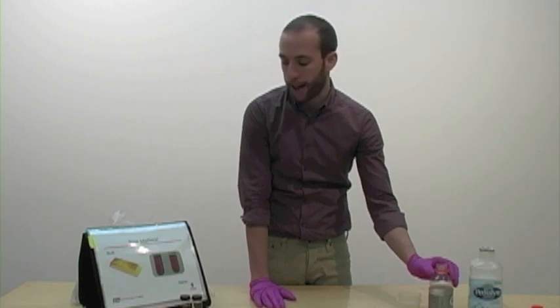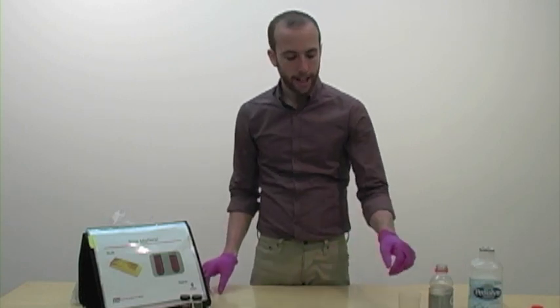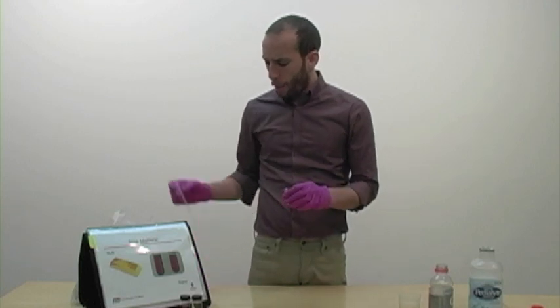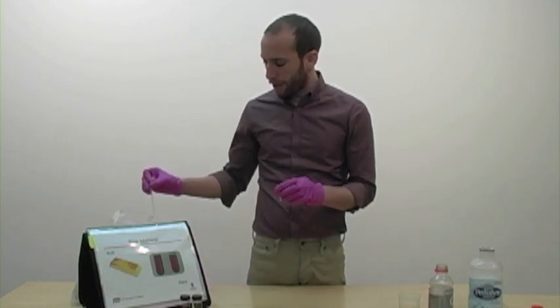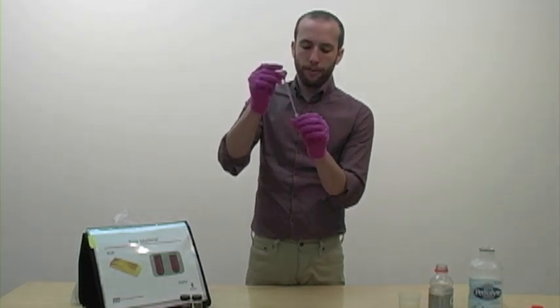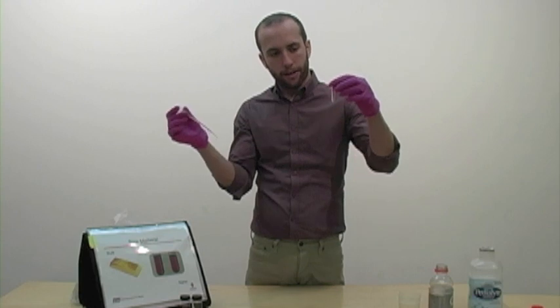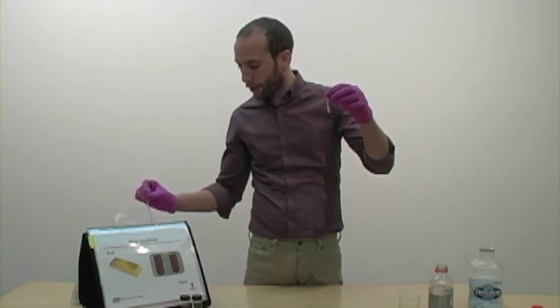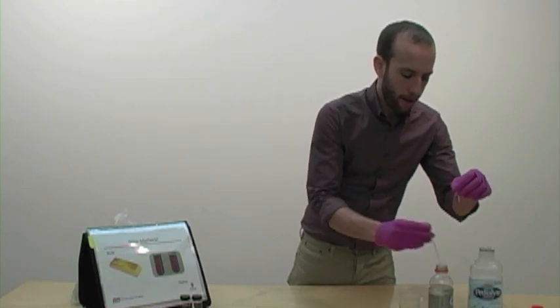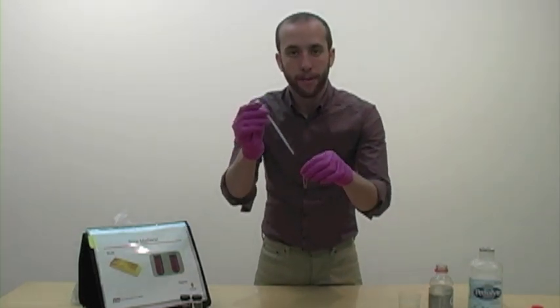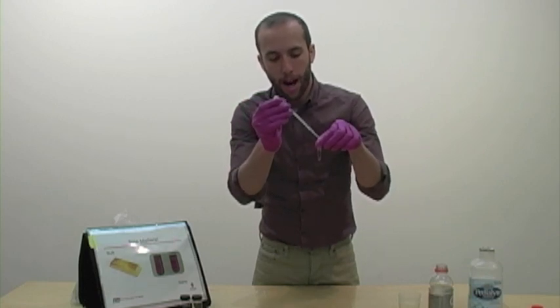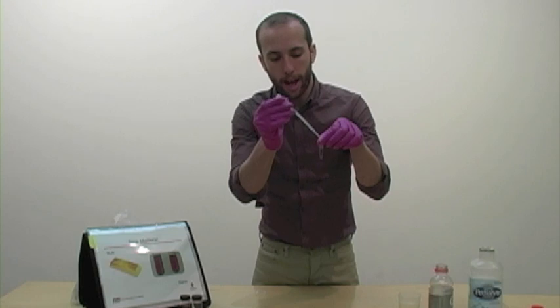Okay, so let's say that it was Gatorade. So what I'm going to do then is I'm going to hand you this vial here, and I'm going to fill it with nanogold. I'm just going to fill it about halfway with some nanogold. So there we go. You can see that it's got kind of a nice deepish red here. And what I'm going to ask you to do is I want you to put in the amount of drops of Gatorade it takes for the solution to change color. And I want you to count every drop. So go ahead and count with me.